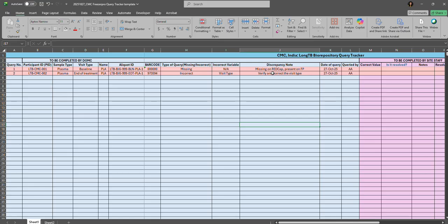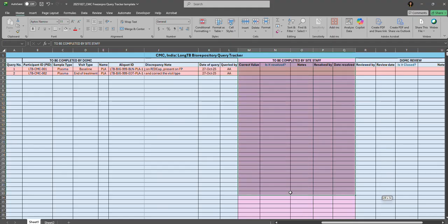A detailed note on the discrepancy will be added in the discrepancy note column. DOMC staff will also enter their initials and the date the query was opened in the fields shown here. Once all the queries are open, DOMC staff will notify the site staff about the queries that are opened on the log through emails or via routine site calls. The site staff will open the log and review all the open queries that are highlighted in red. Once the staff reviews and corrects the discrepancies, they must also respond to the queries in section B, the second section to be completed by the site staff.